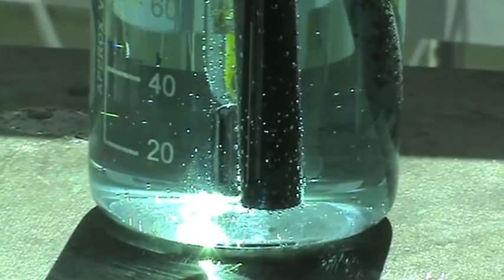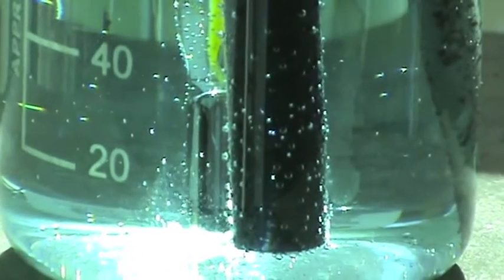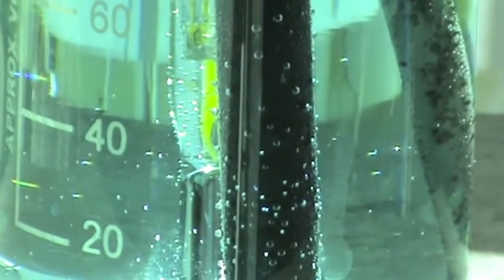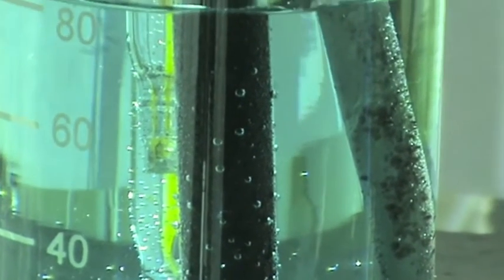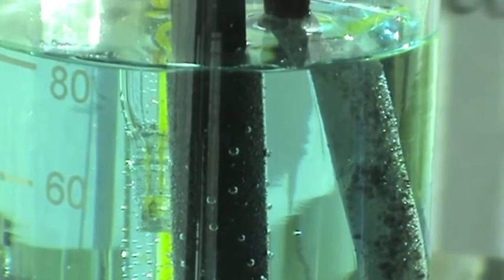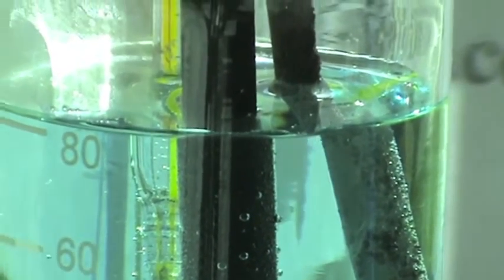During the course of the deposition, bubbles can be seen scattered over the graphite electrode. This is a serious problem, as the presence of these bubbles doesn't give a smooth and adherent deposit of lead dioxide.